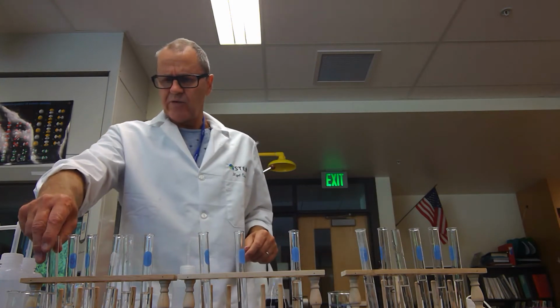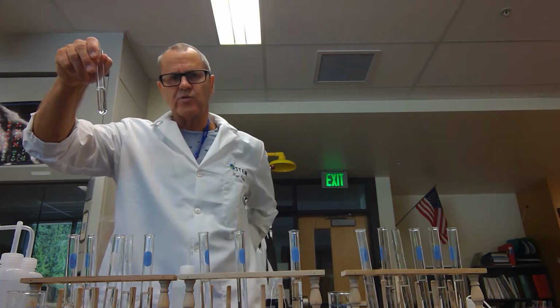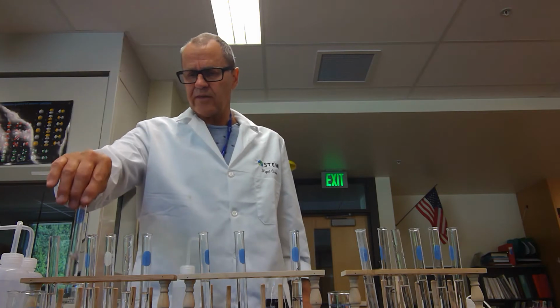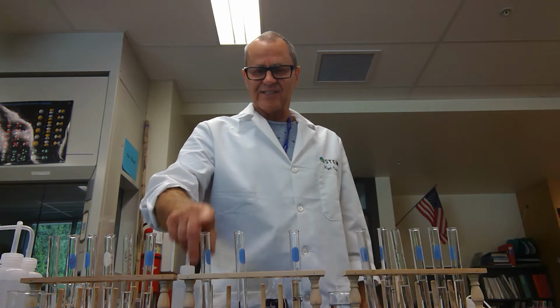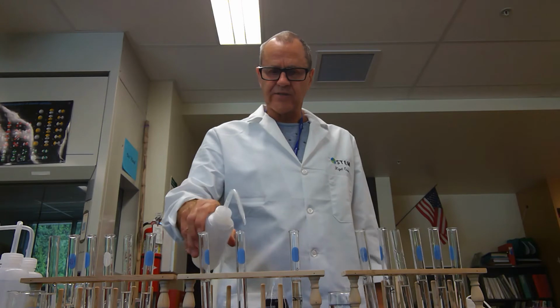I did the same with NaOH starting from this end. So there is 1.0 molar sodium hydroxide, 1/10th, 1/100th, 1/1,000th, 1/10,000th, 1 over 10 to the 5, 10 to the minus 6. And in the middle, I just filled that up with distilled water.